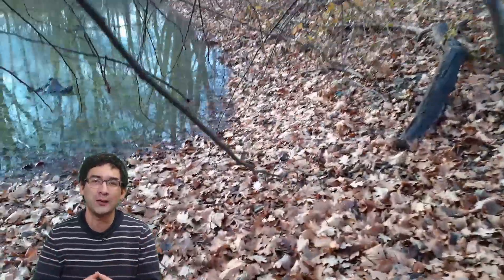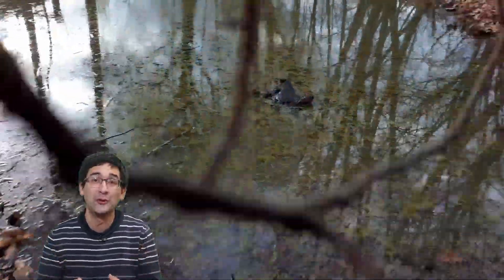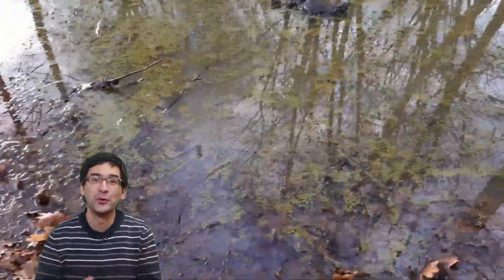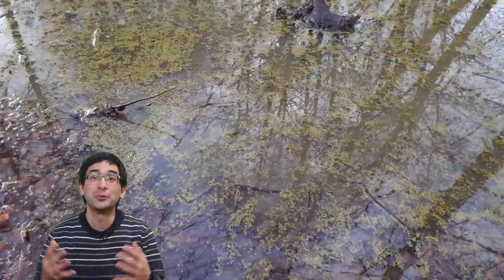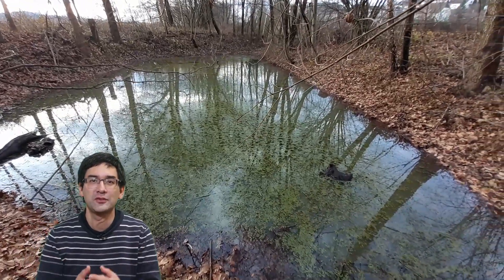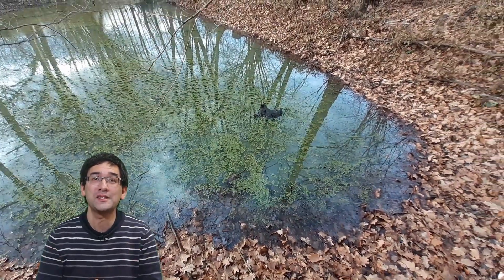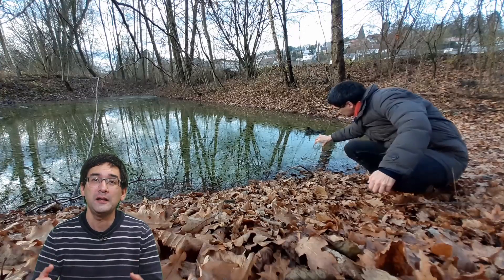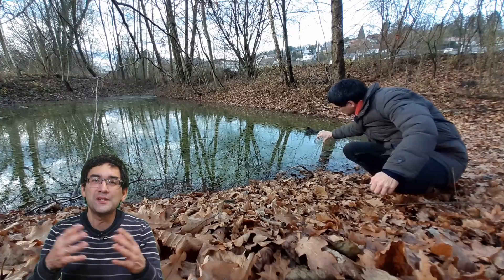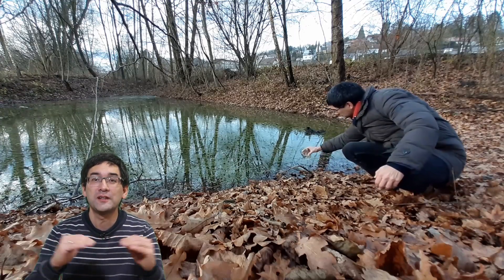This is the home of Cyclops — a freshwater pond. Luckily the temperature is not so cold, so the water hasn't frozen yet. Originally I wanted to collect some protozoans here. I've done so before because there were lots of decomposing leaves, so I thought this would be an ideal place for paramecia and other ciliates to grow. I took out a sample of water and put it back to swirl up the ground sediment a little, because I wanted to collect some of the microorganisms that had settled on the ground.